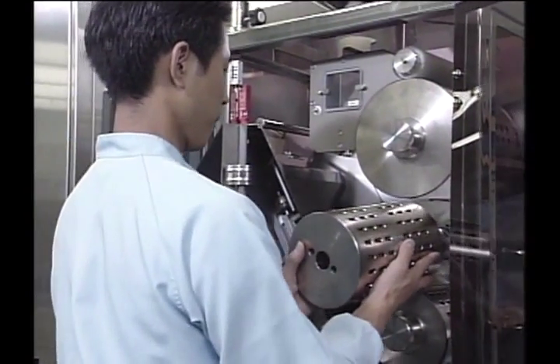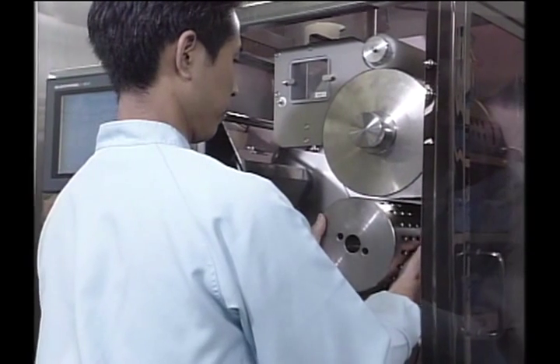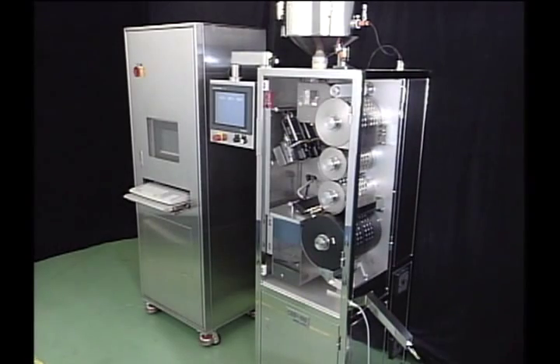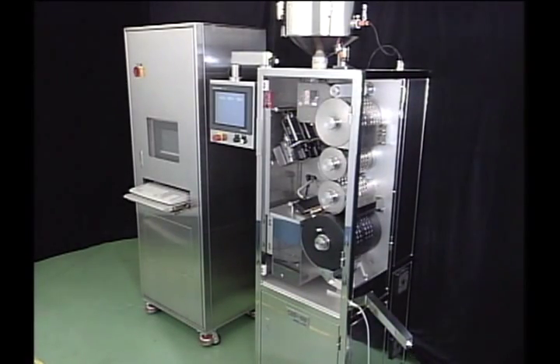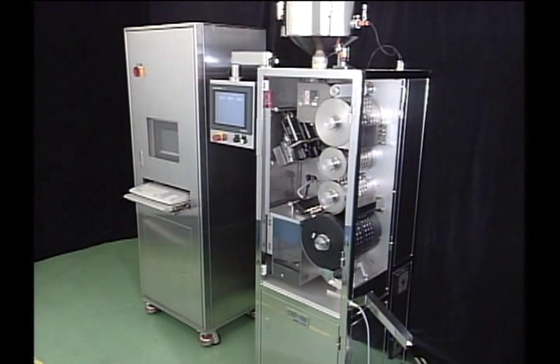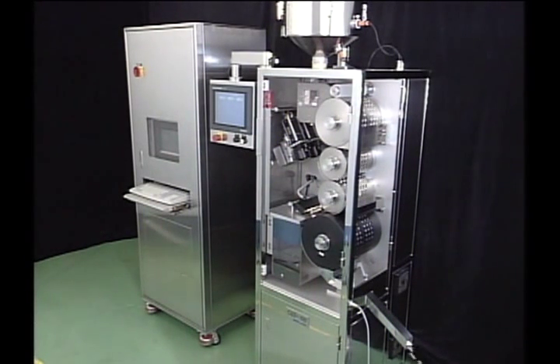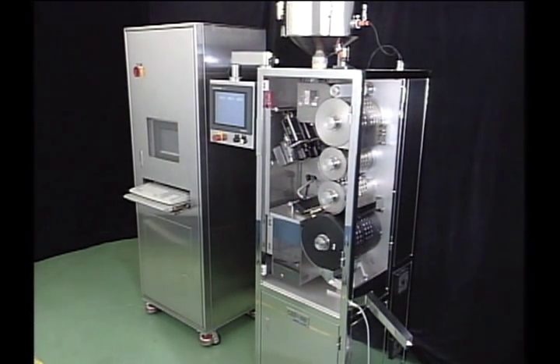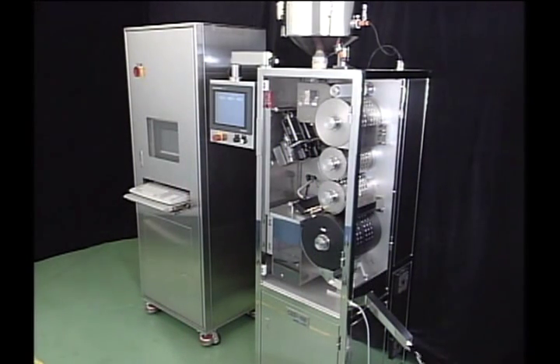We can say that this machine was also developed by considering its versatility and wide range of uses. The capsules are checked by direct viewing with the camera, which allows inspection of the orientation and rotation of capsules under the same conditions.